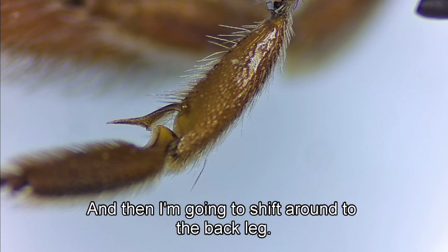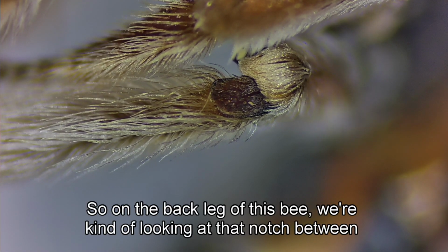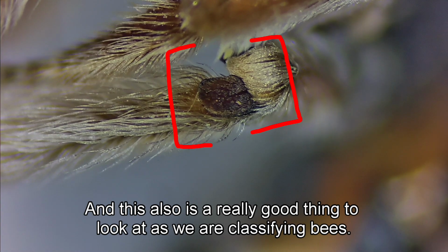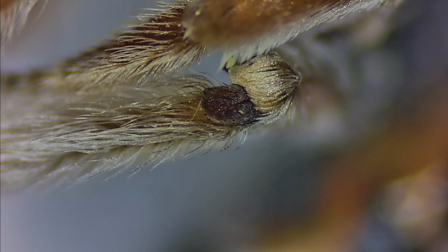And then I'm going to shift around to the back leg. So on the back leg of this bee, we're kind of looking at that notch between the femur and the tibia, and this is the basitibial plate. And this also is a really good thing to look at as we are classifying bees.